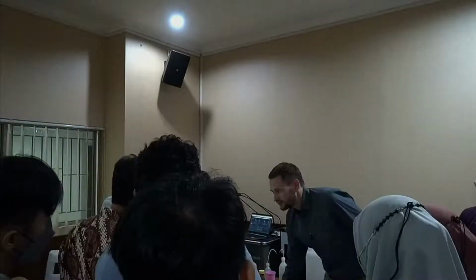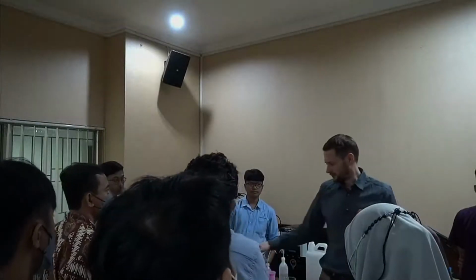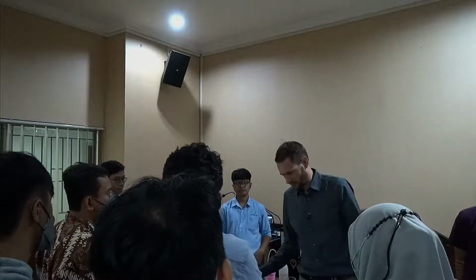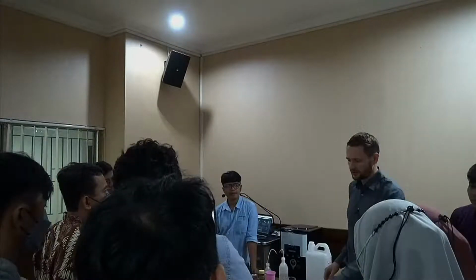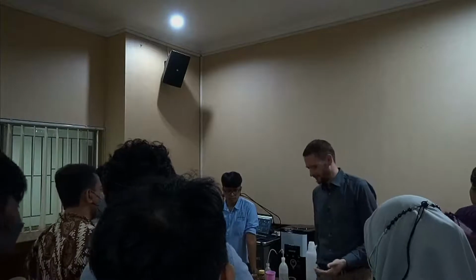You just measure something, you throw it in directly, measure it, you get 3 different results. You're asking yourself, why is it not measuring properly? Of course, it's measuring properly. You're not feeding it properly. That's in 99% of the cases the issue here.